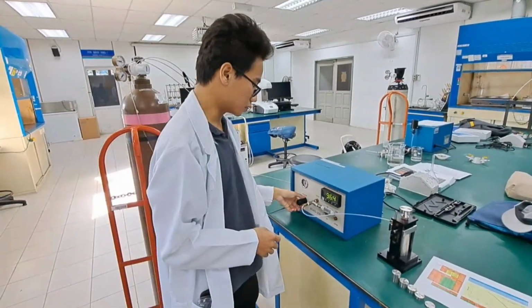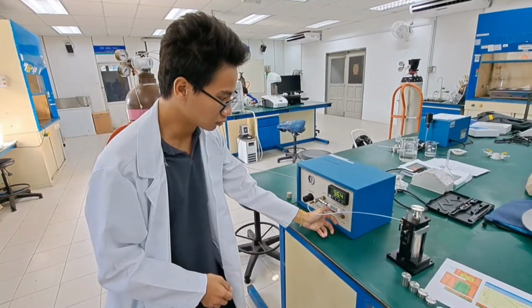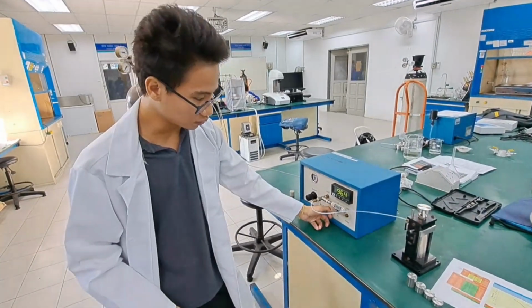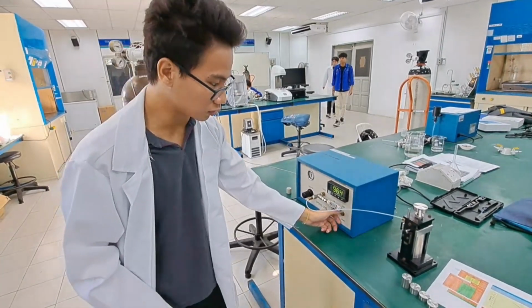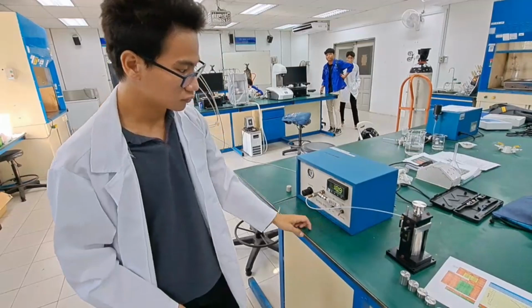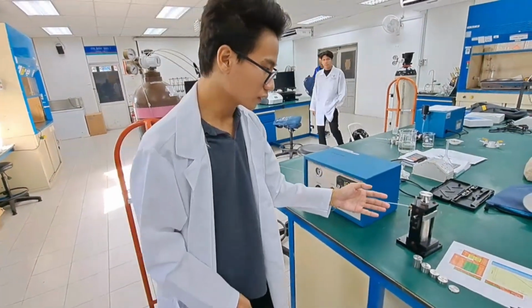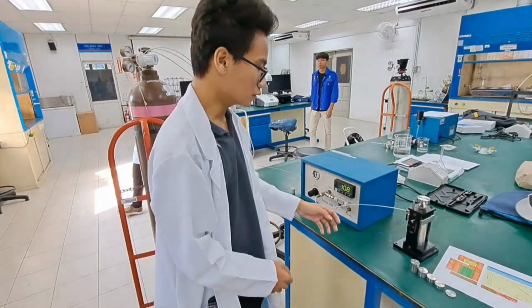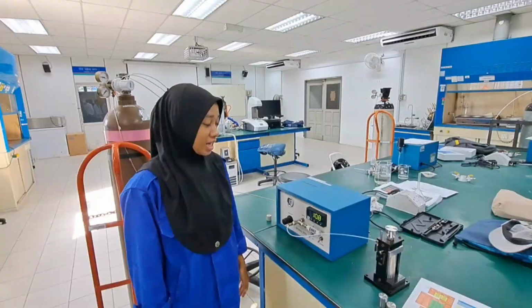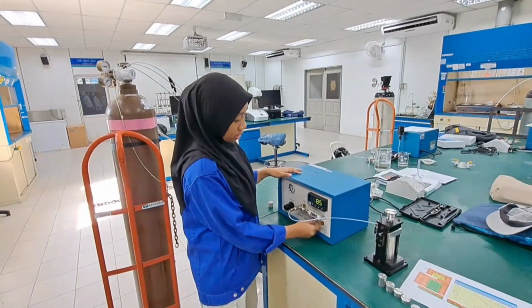Then we go to on, we let it off, and we wait for a while, and then we go to off. Then we take the reading of the pressure for this core. Go ahead. Next, we will run this first. And on.